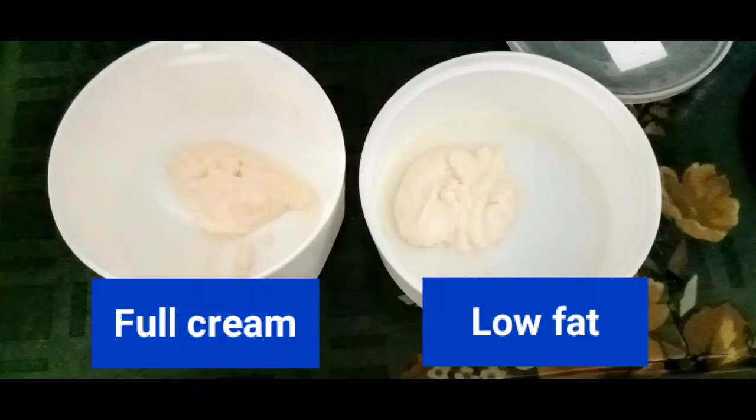The results show the amount of casein obtained from both milks is about the same. The amount of milk fat in the milk doesn't affect the amount of casein or whey protein in the milk. Both types of milk contain milk proteins including casein.